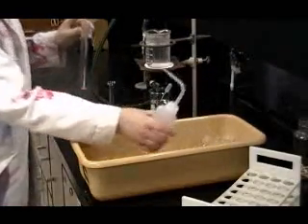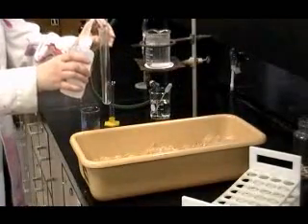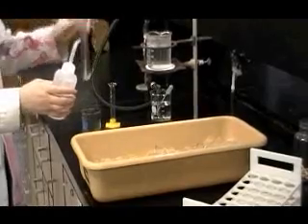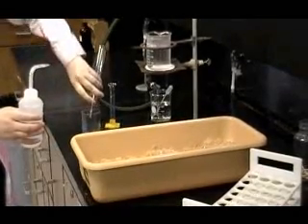Once crystals of aspirin appear in the beaker, rinse the test tube with small volumes of ice-cold deionized water from your wash bottle. Add the rinse to the solution in the 150 milliliter beaker.